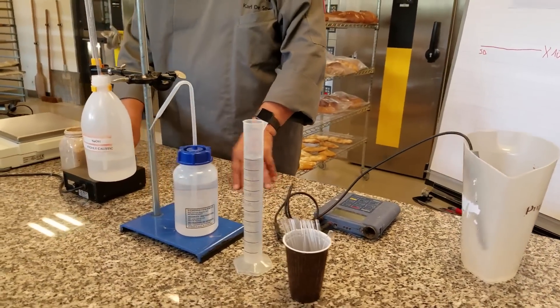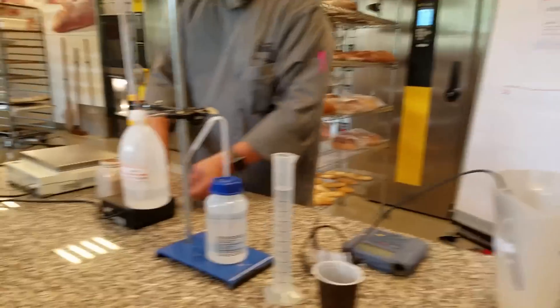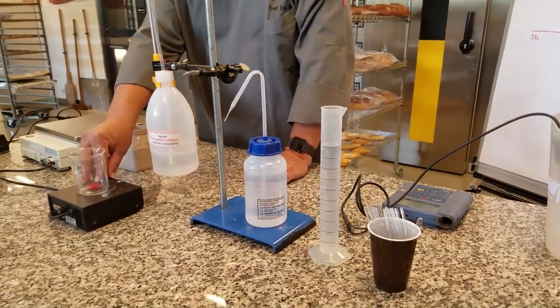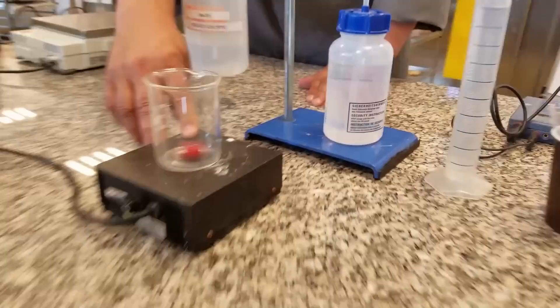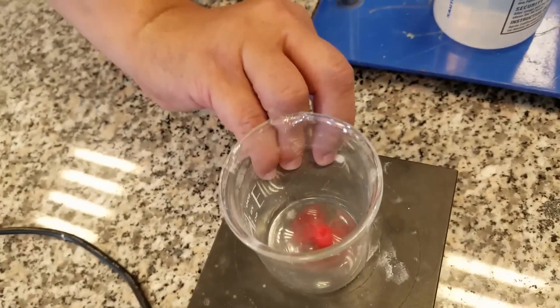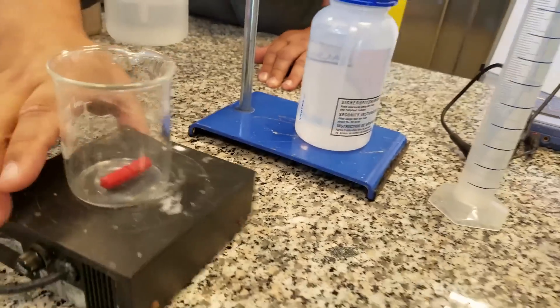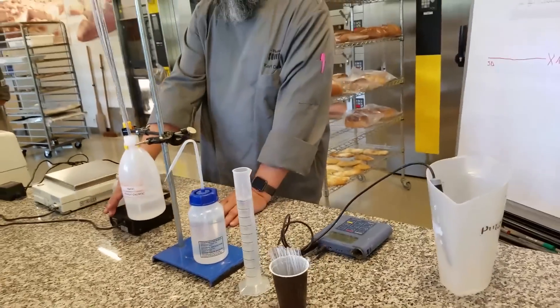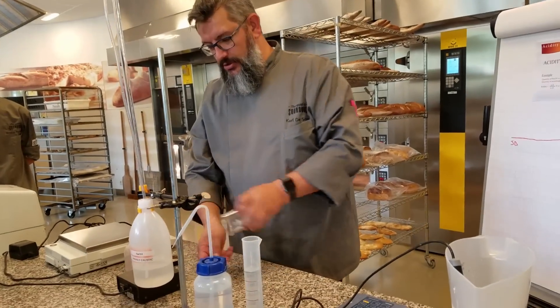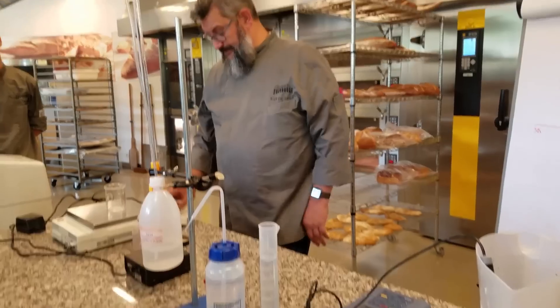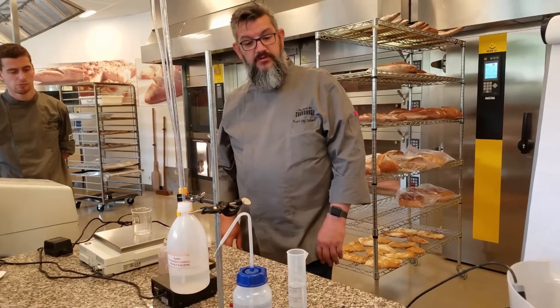It will mix my starter. Can you push it out a little? With the water. You can come and adjust the magnetic field and that will allow me to mix my water and my sourdough. So what I need is to scale 10 grams of sourdough.